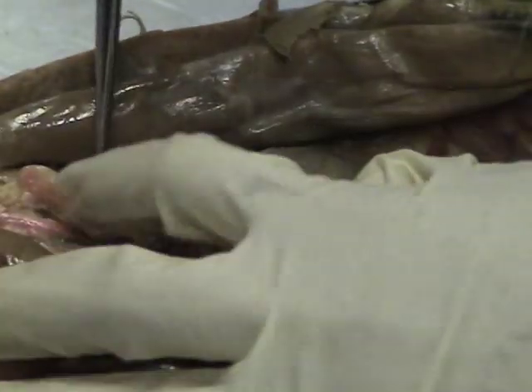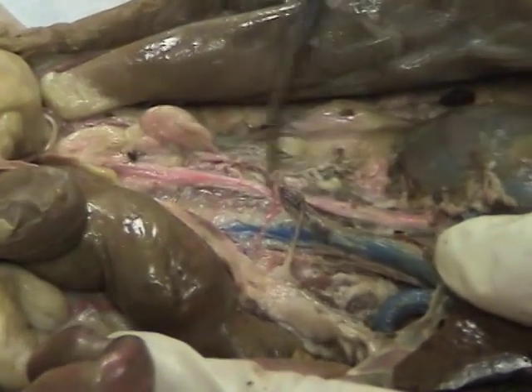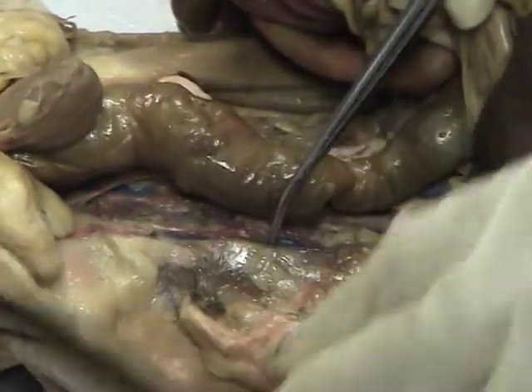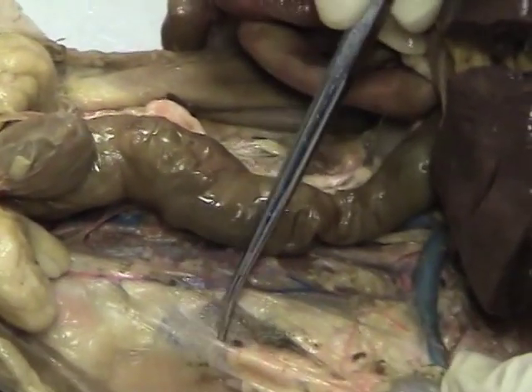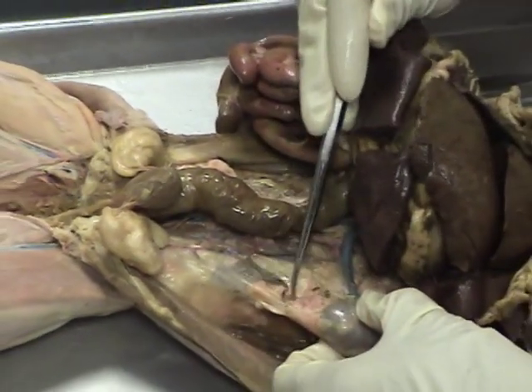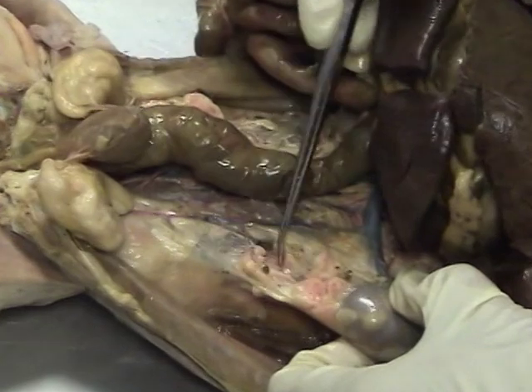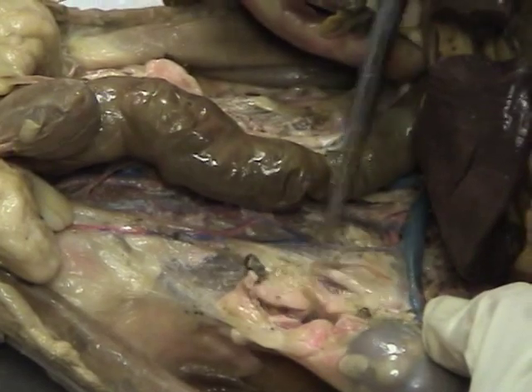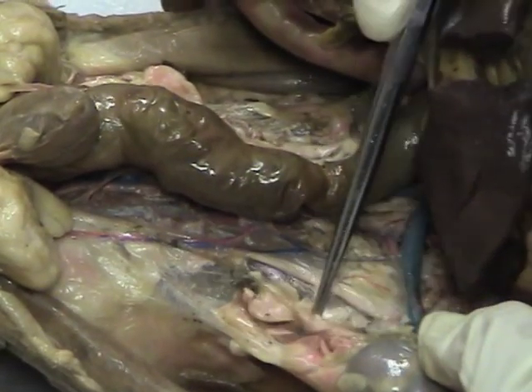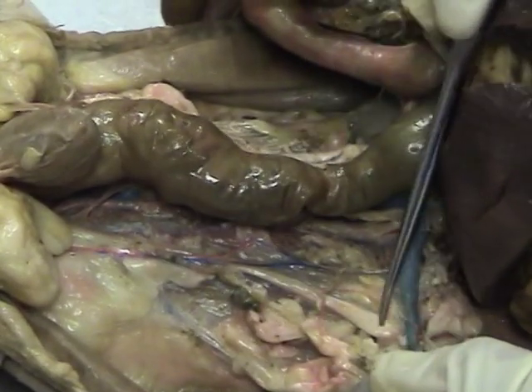Then we have ureters coming down from the kidney. In this example, this white tube coming on down would be the ureter coming from the right kidney. On the other side, we have the same thing, but it's not as obvious because it's still buried in this peritoneum. When I stretch a kidney like this, you can see a tube approximately right here. The white tube is the ureter from the other side.